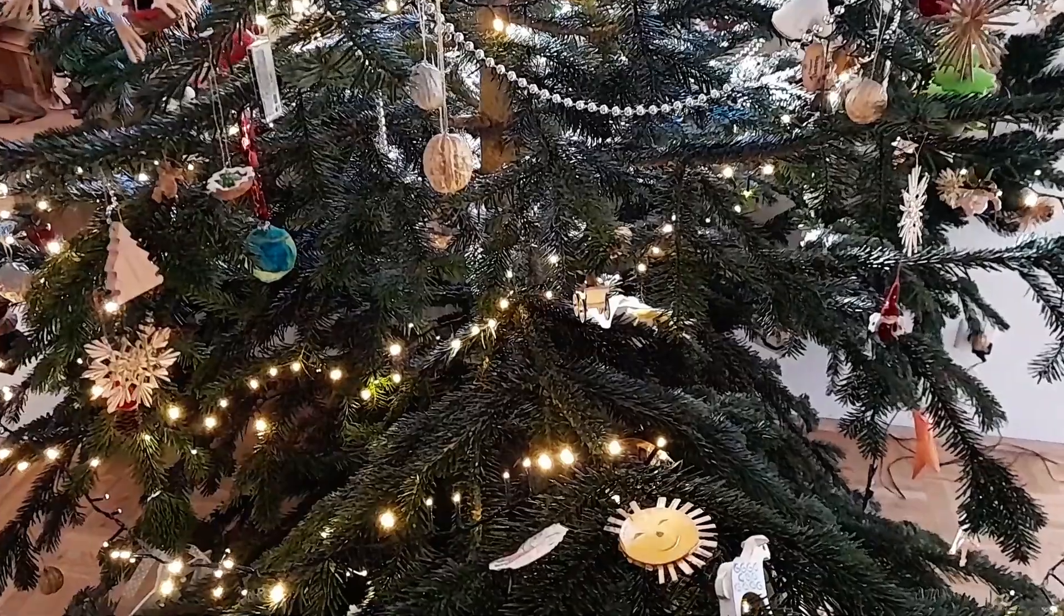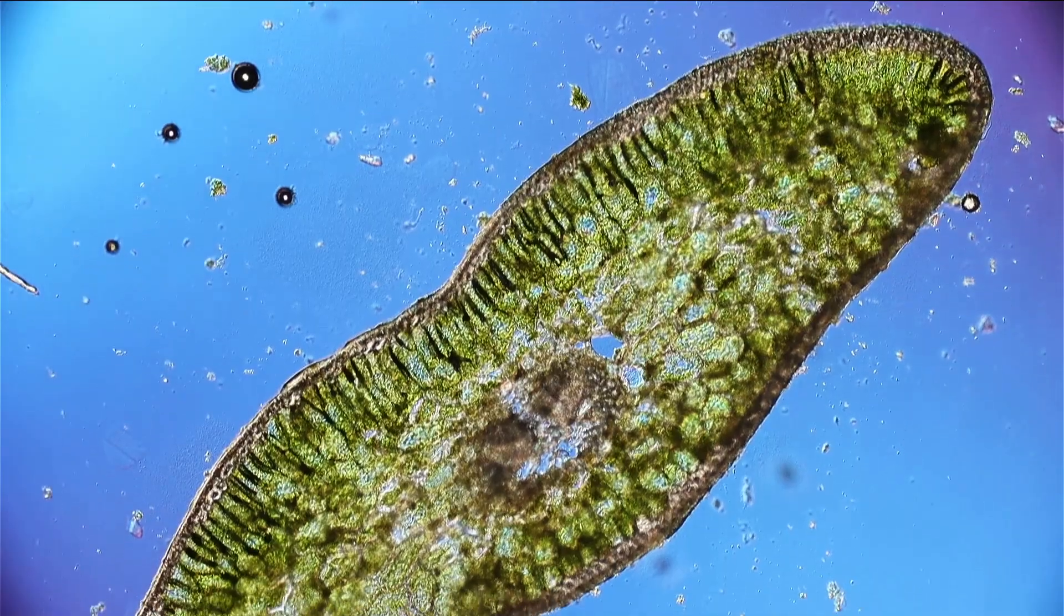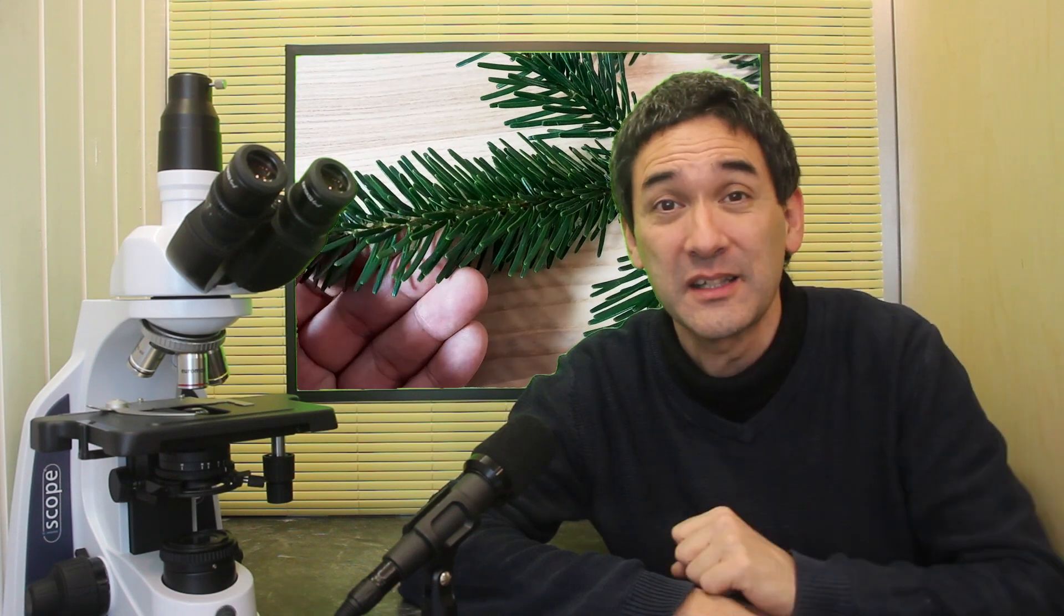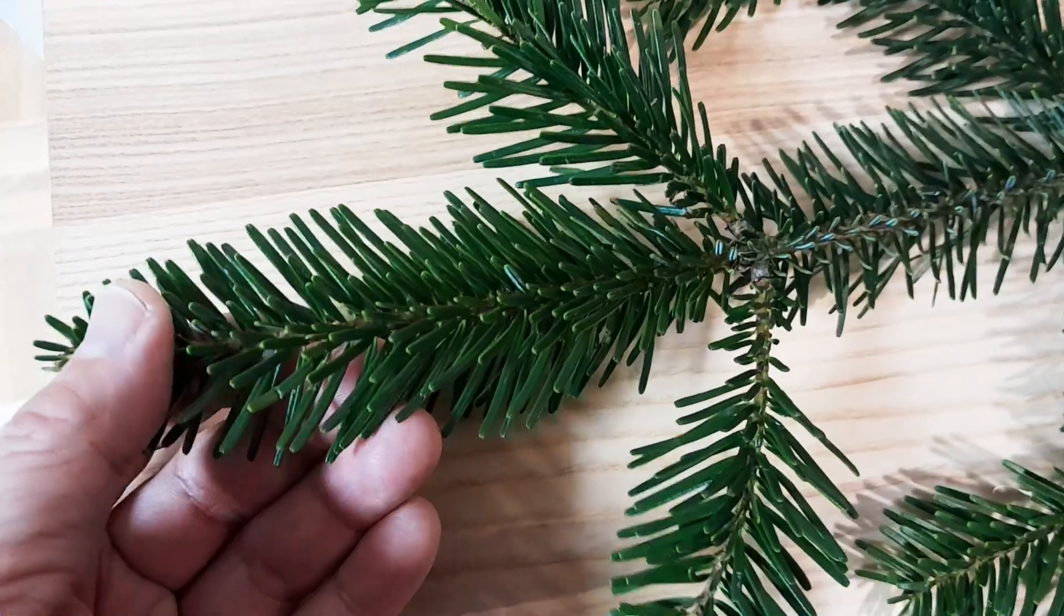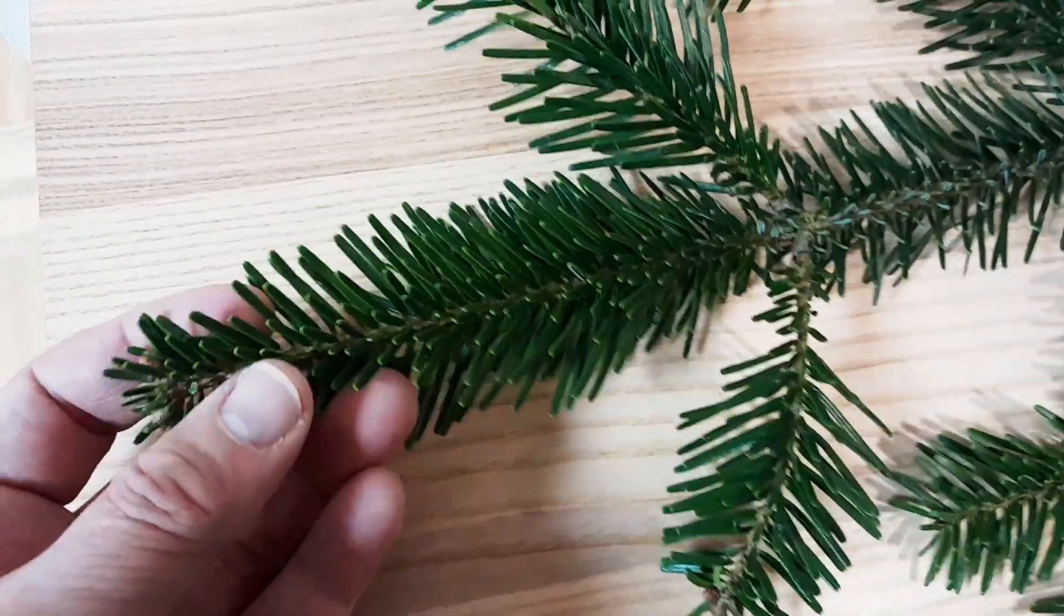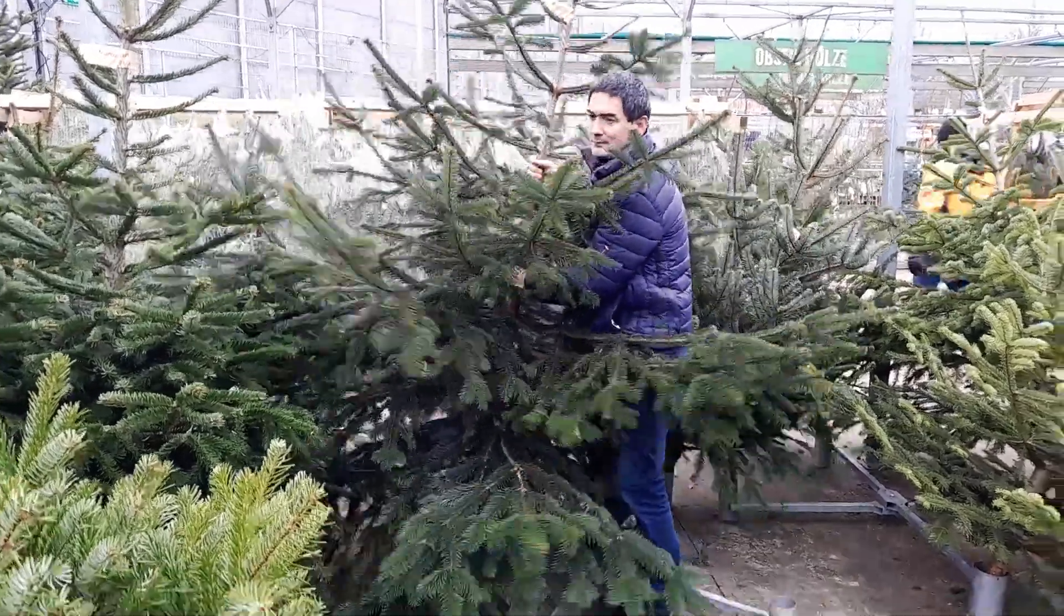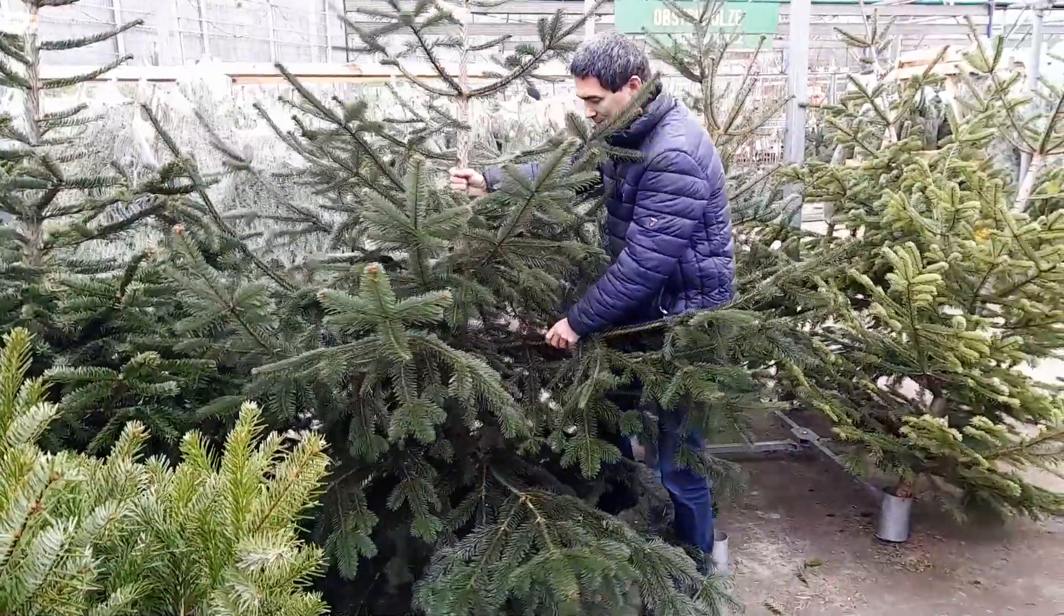A little bit of background information first. Every time during Christmas I usually put something under the microscope that's a little bit related with Christmas. In previous years I usually put some of those fir leaves, fir needles under the microscope, and this year I decided to increase the level of difficulty a little bit more and I said I wanted to determine the number of cells that can be found in my Christmas tree.